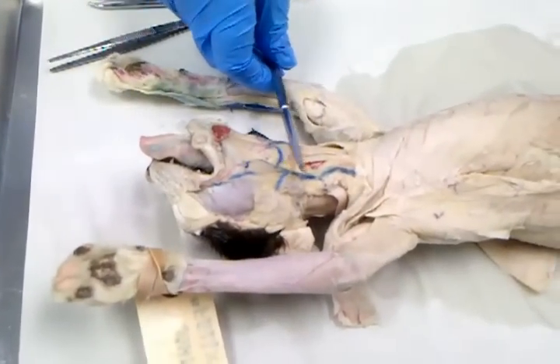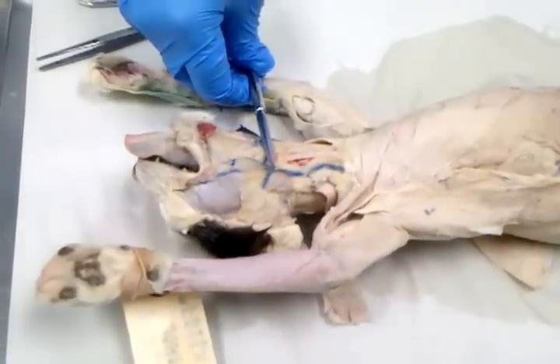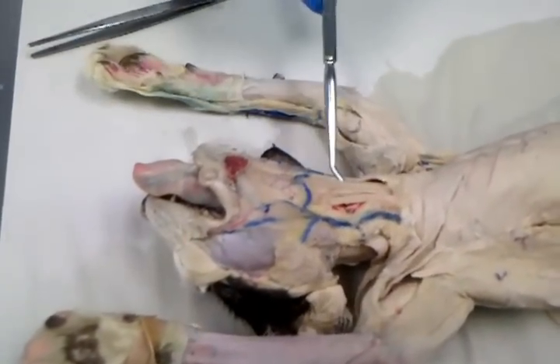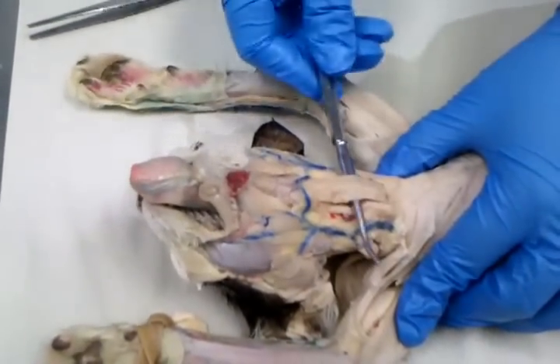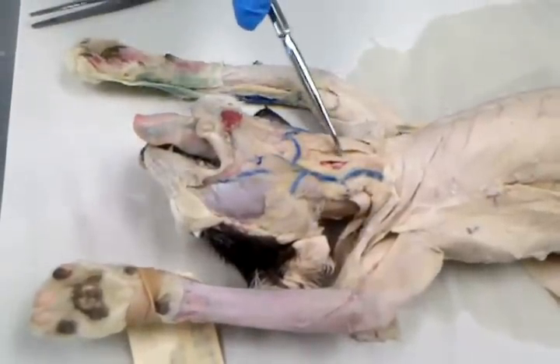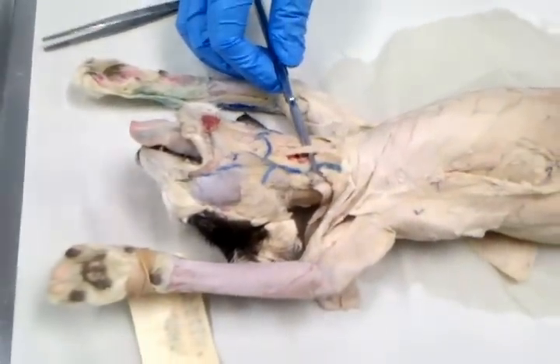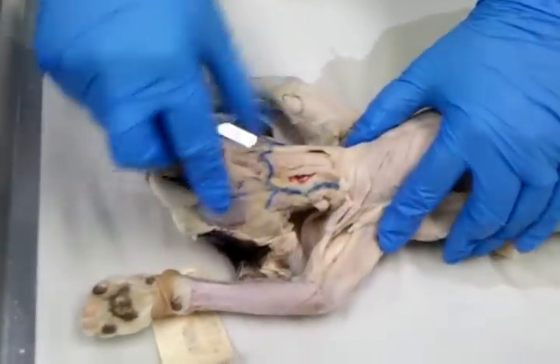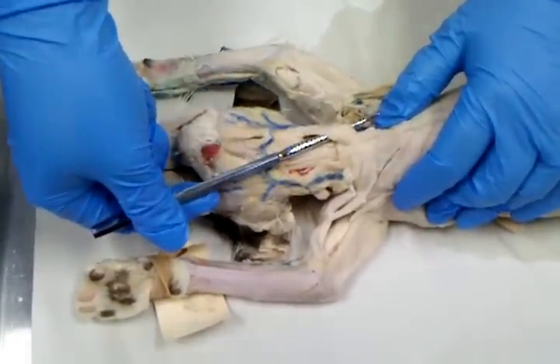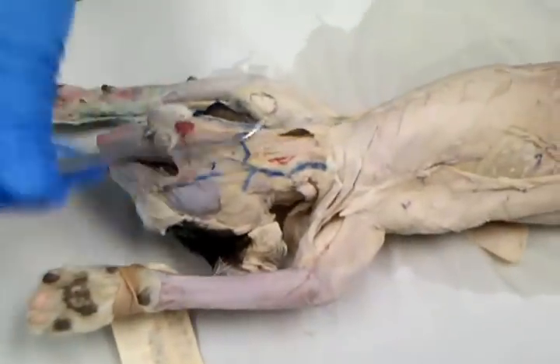Now in the lower portion of the neck right here are three muscles you have to know. They all start with sterno. So you've got sternohyoid, because it's below the mylohyoid. And then off to the side and deep, you've got sternothyroid, and it's skinny. Now on the side of the neck, coming up from the sternum, you've got sternomastoid. So that was head and neck muscles.